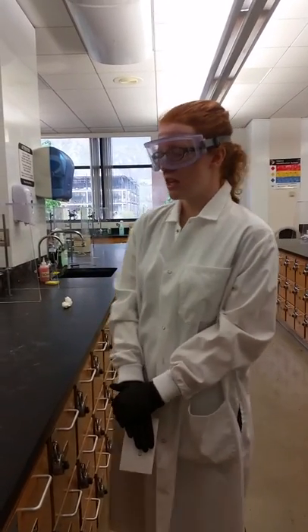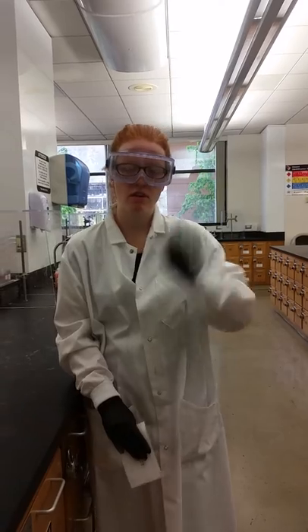Hello, my name is Holly Smith. I'm in Section 1 and my TA is Michael Smith. I'm going to be demonstrating measuring the volume of a graduated cylinder laboratory skill.